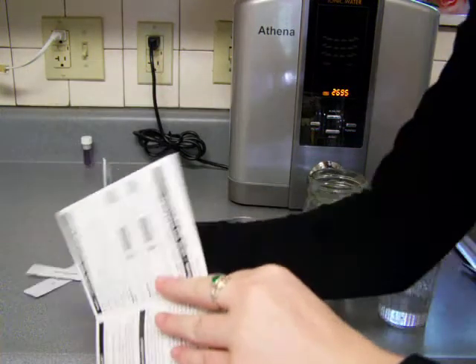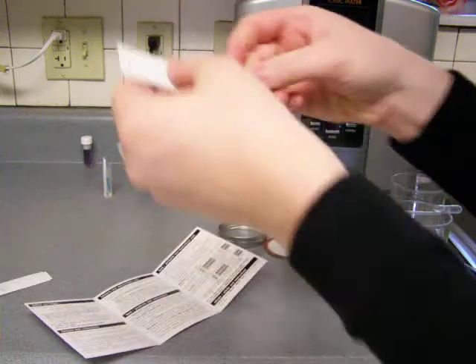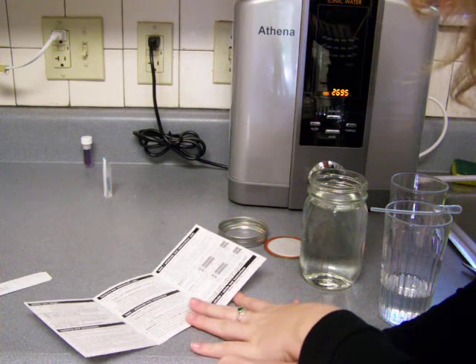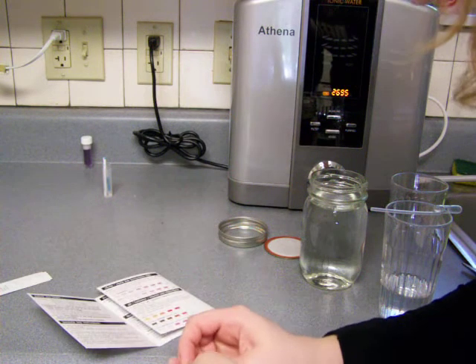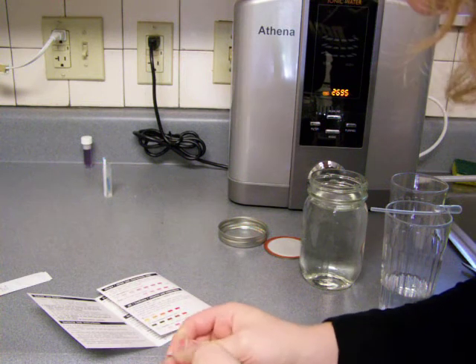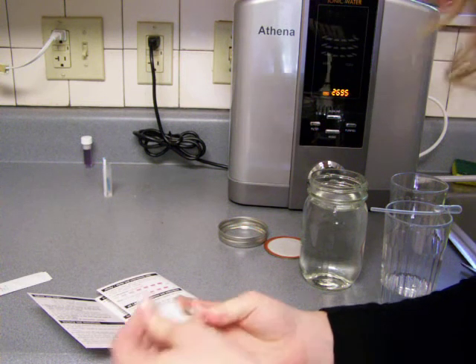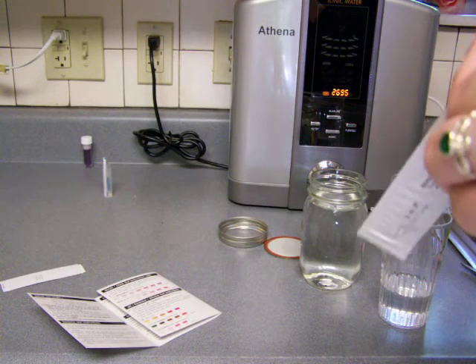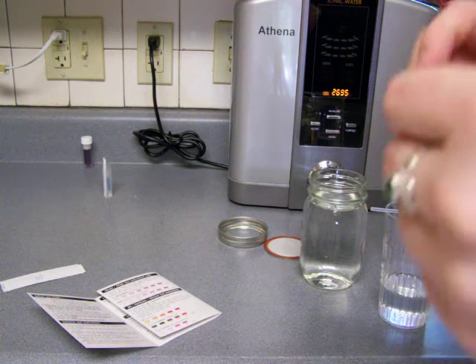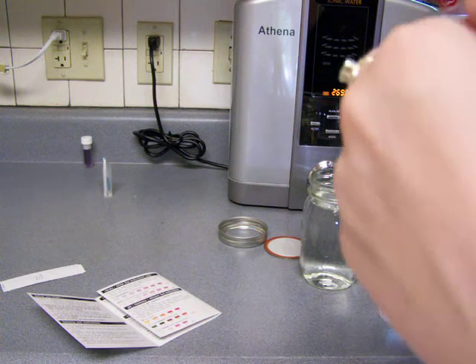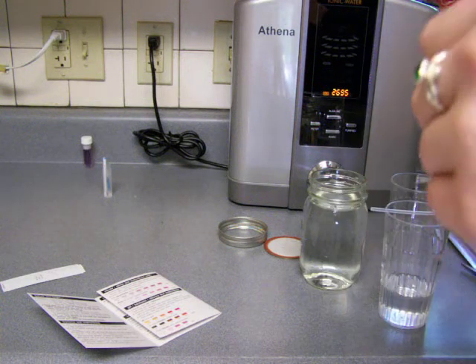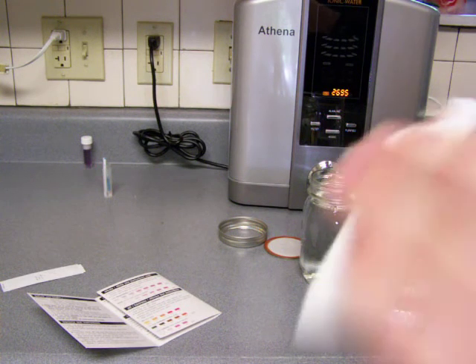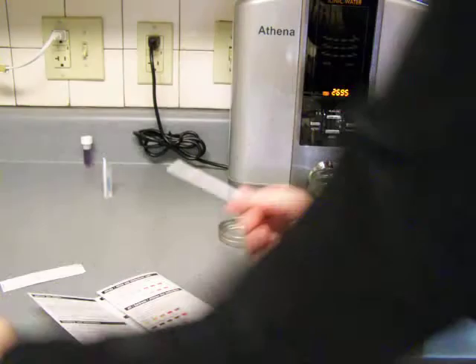So now this is the nitrate nitrite, which is this little thing here. Carefully open nitrate nitrite test packet and take out the test strip. This is harder than it looks. Ha ha. I got the test strip.